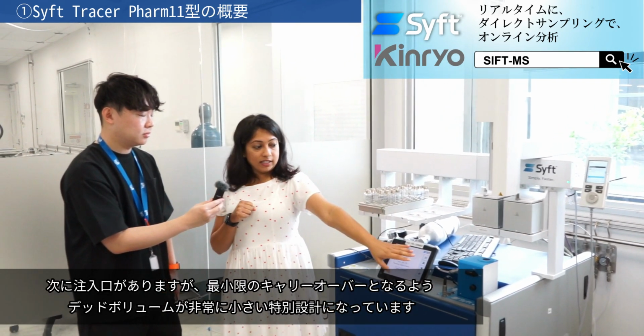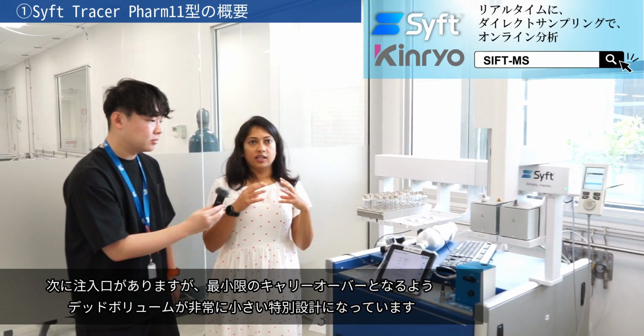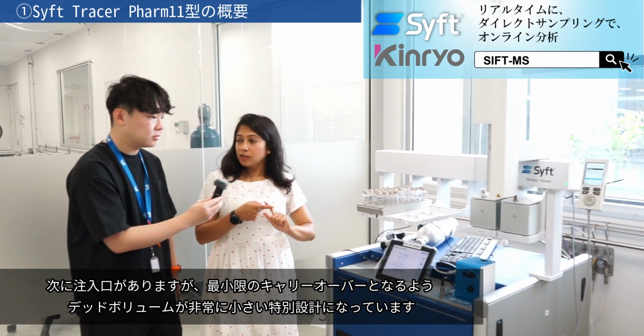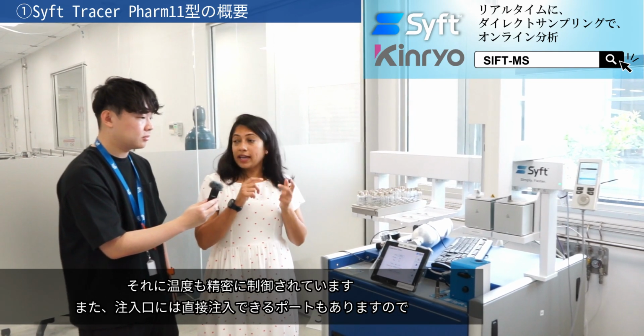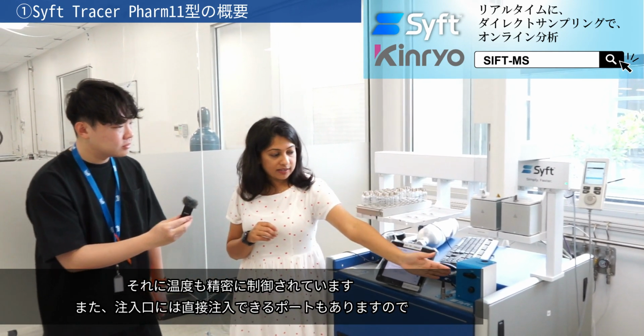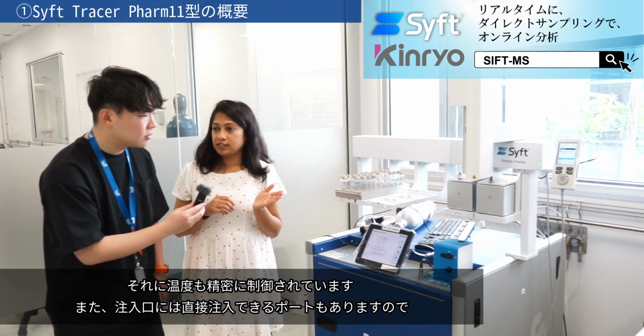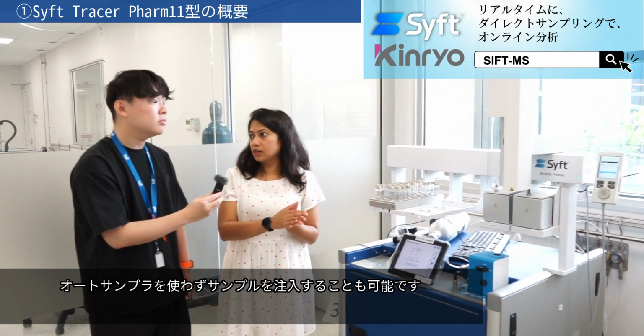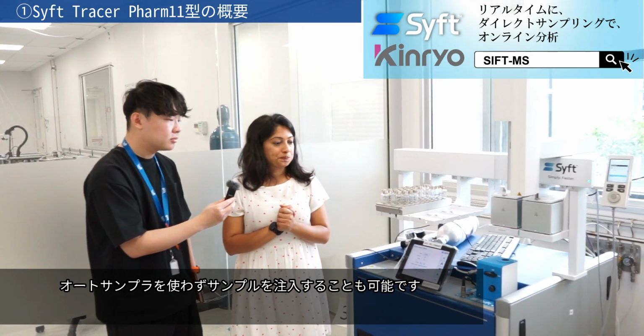And then we have the inlet. So the inlet is specifically designed to have minimum carryover, very low dead volume, again temperature controlled as well. The inlet also has an auxiliary port, which is a direct port. So if you have applications outside your auto sampler, you can also use the direct port.